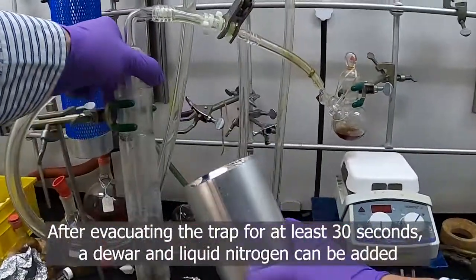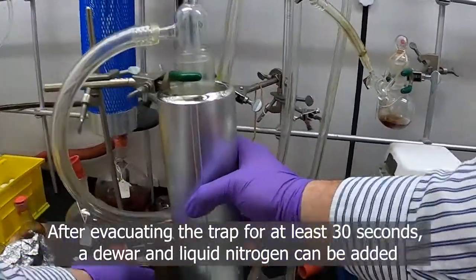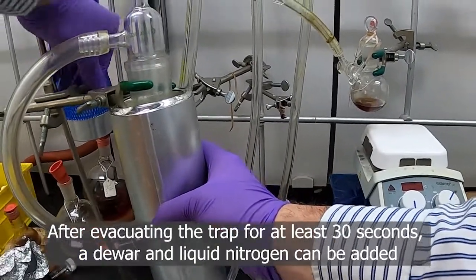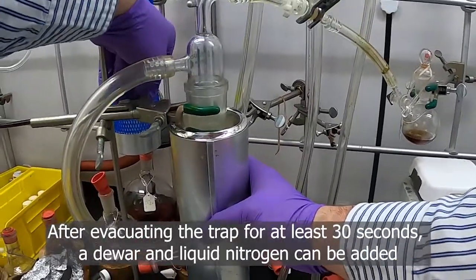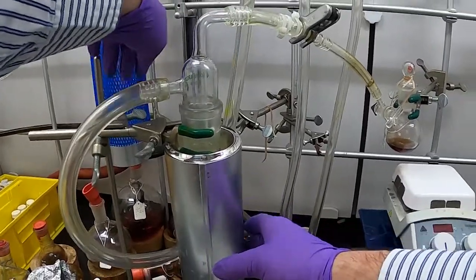Then we add our liquid nitrogen Dewar underneath. We'll raise that up a little bit so we're completely on our lab jack here.